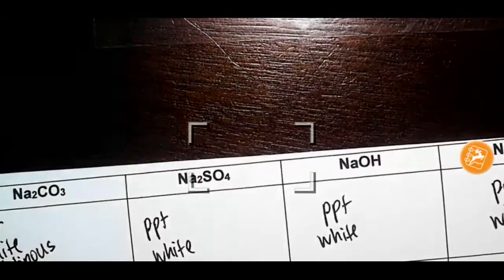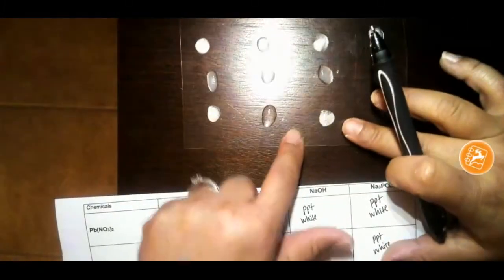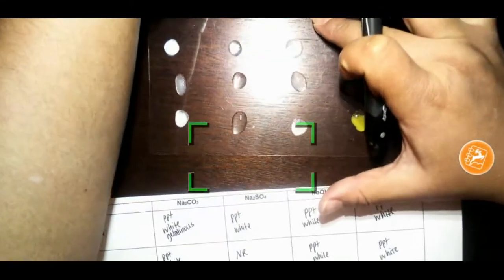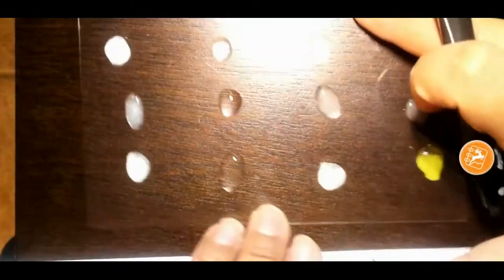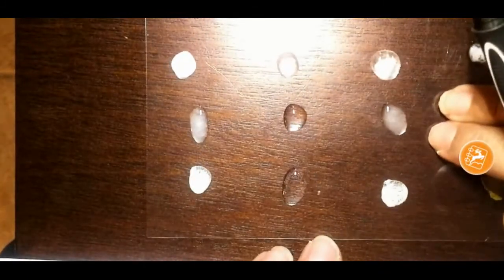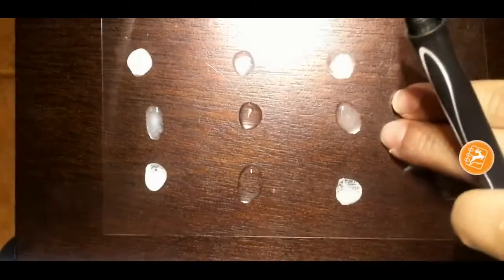And then now what you're going to do is record another term for these three. So I'm going to zoom in so you can see these. I'm going to shake it a little so that you can see what they look like.